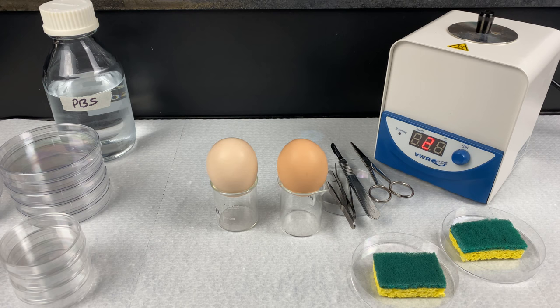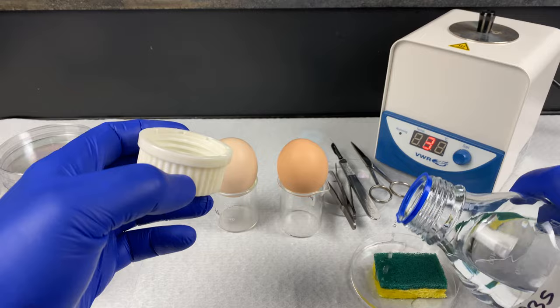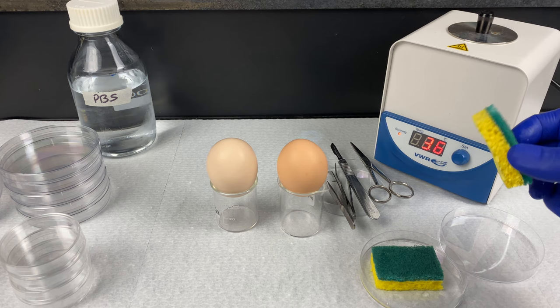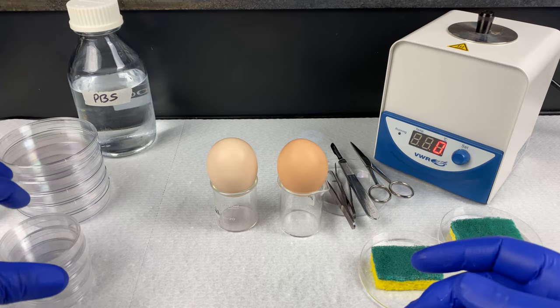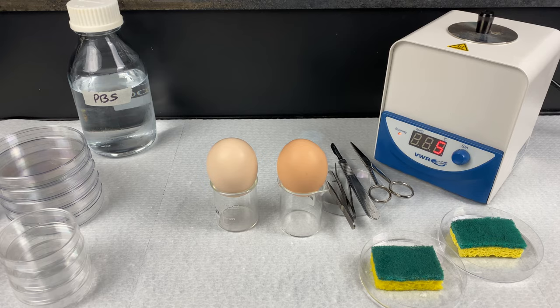Try not to knock over your eggs. We have two sponges for washing our equipment — standard kitchen sponges cut into quarters. One will be wet with a little bit of sterilized PBS on top, and the other will be dry. Whenever working with these instruments, before placing them in the Steri, they must be clean and dry. We have large Petri dishes and smaller ones. We'll transfer individual organs into the smaller dishes, but the whole embryo goes into the larger dish. The Steri is only at 45 degrees presently, so start it early to allow it to heat up.